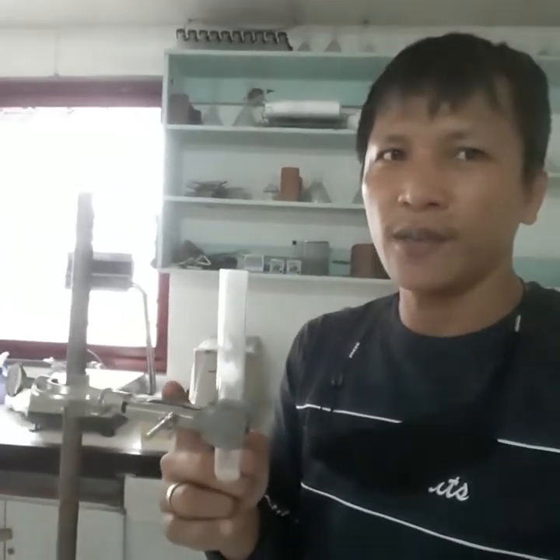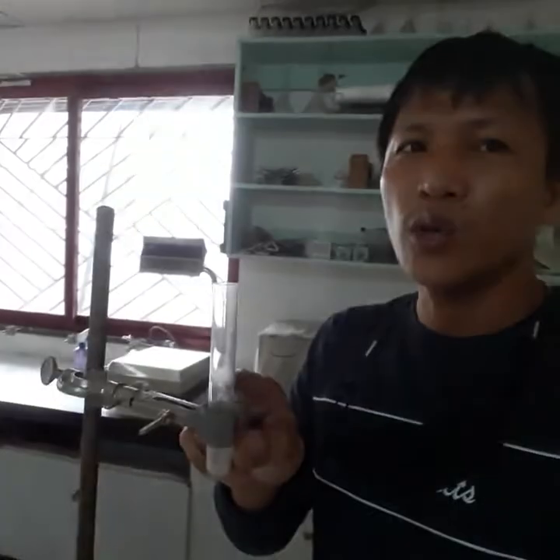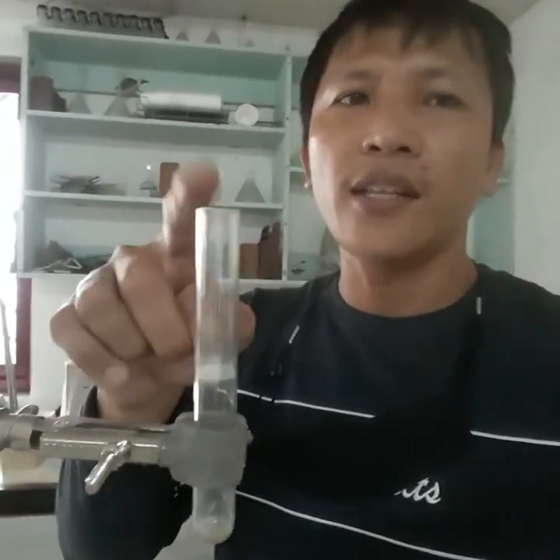The test tube holder is something you can hold in your hands, but this one is a clamp holder wherein it is being clamped. So you can also put anything on your clamp holder. You can put thermometers. I've already put some thermometers. Of course, you just have to devise a mechanism for it to be mounted on this tip. Also, some small type of, let's say, a Florence flask. Anyway, that's the next item. So this one is a clamp holder, and then you have test tubes.